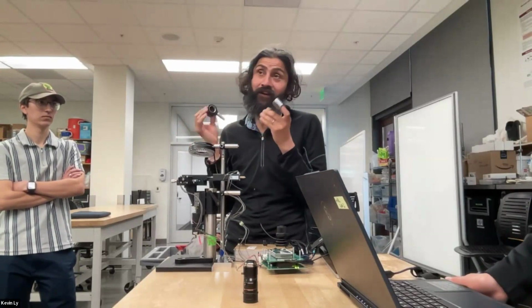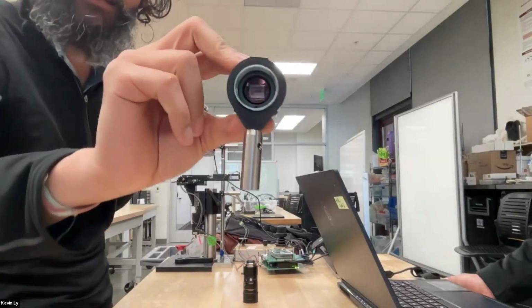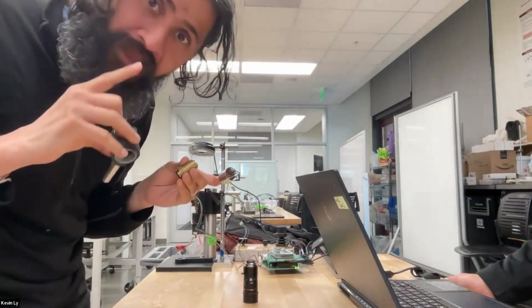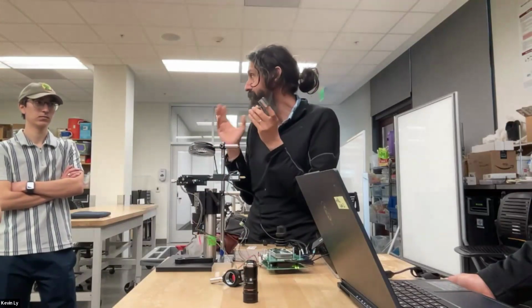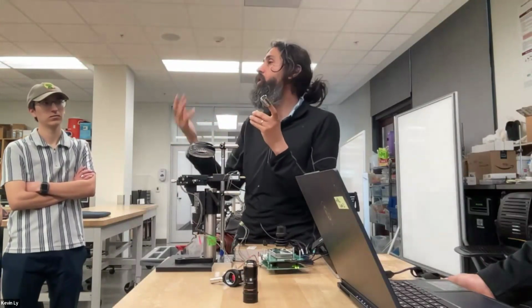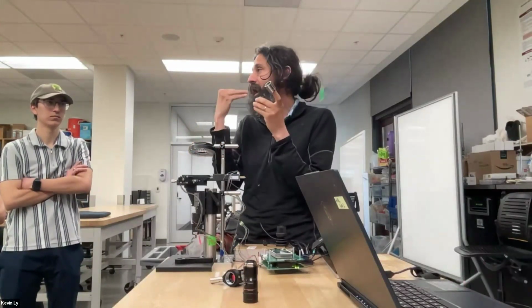Like our eyeballs are curved. Does that make sense? So this is flat, it's not curved. Our eyeballs are curved. When you make lenses, many of the objectives are actually correcting for this. It's called flat field, but you can only get flat field to a certain point. Then I can go on and on, from a fluorescence point of view. So that's the stack that adds up.